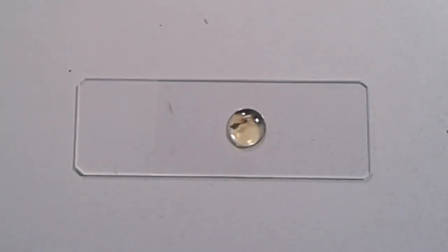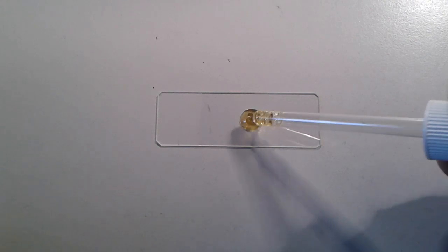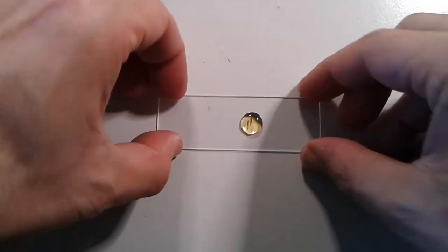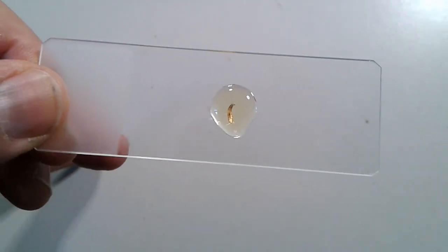If I had thrown it out into the garden it would have frozen to death — it's winter right now — so its fate was sealed anyway. In any case, another small drop of mounting medium on top and then a cover glass. Now I'm picking up the slide — it's a little bit out of focus, I totally forgot to refocus my camera. Okay, now it's in focus again.